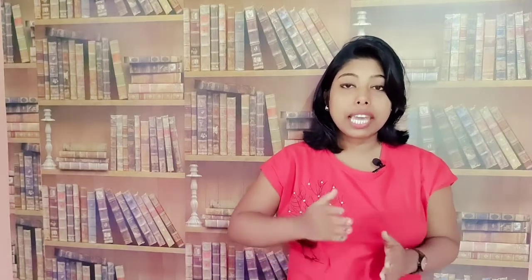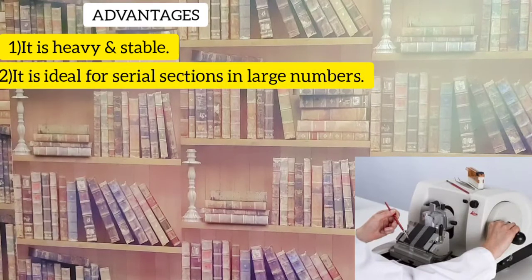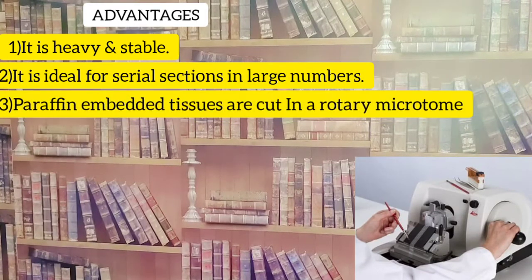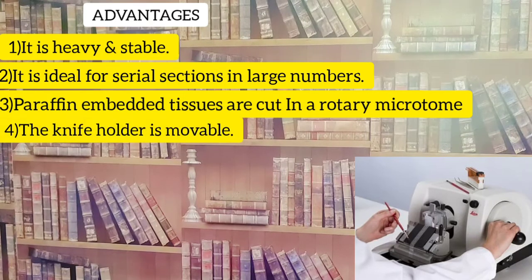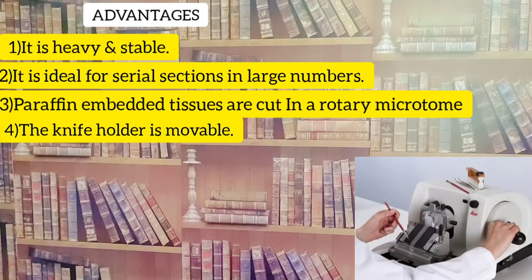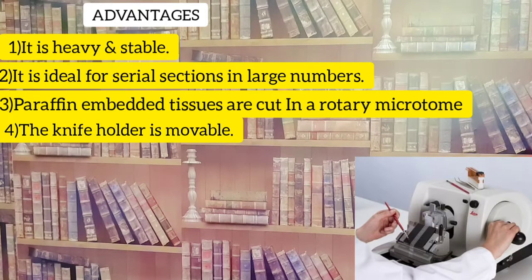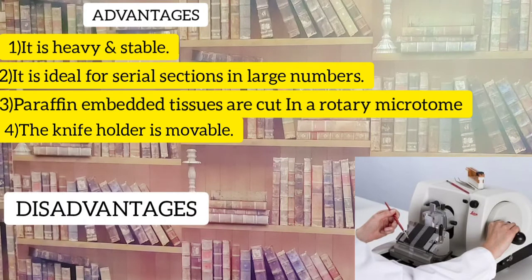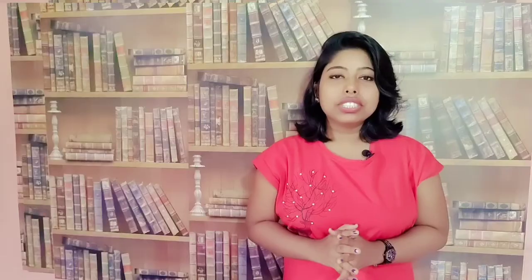The advantages of the rotary microtome: it is heavy and stable, it is ideal for serial sections, and large numbers of paraffin-embedded tissues are cut by it. The knife holder is movable and the sections are cut flat, making it useful for routine research. However, its disadvantage is that it is not suitable for large blocks or hard tissues.